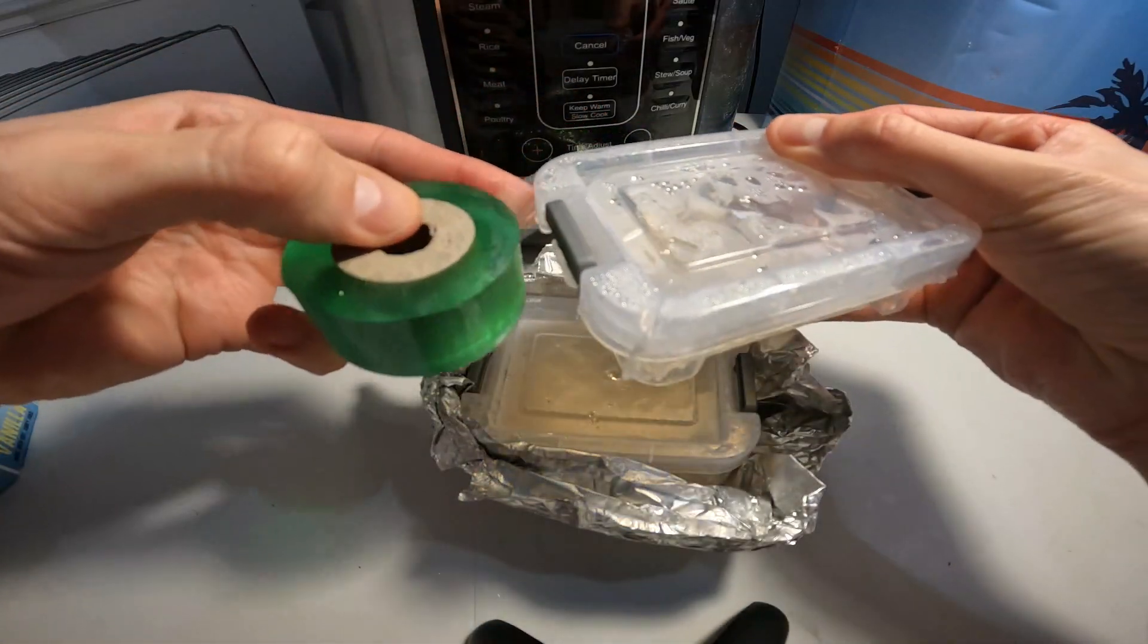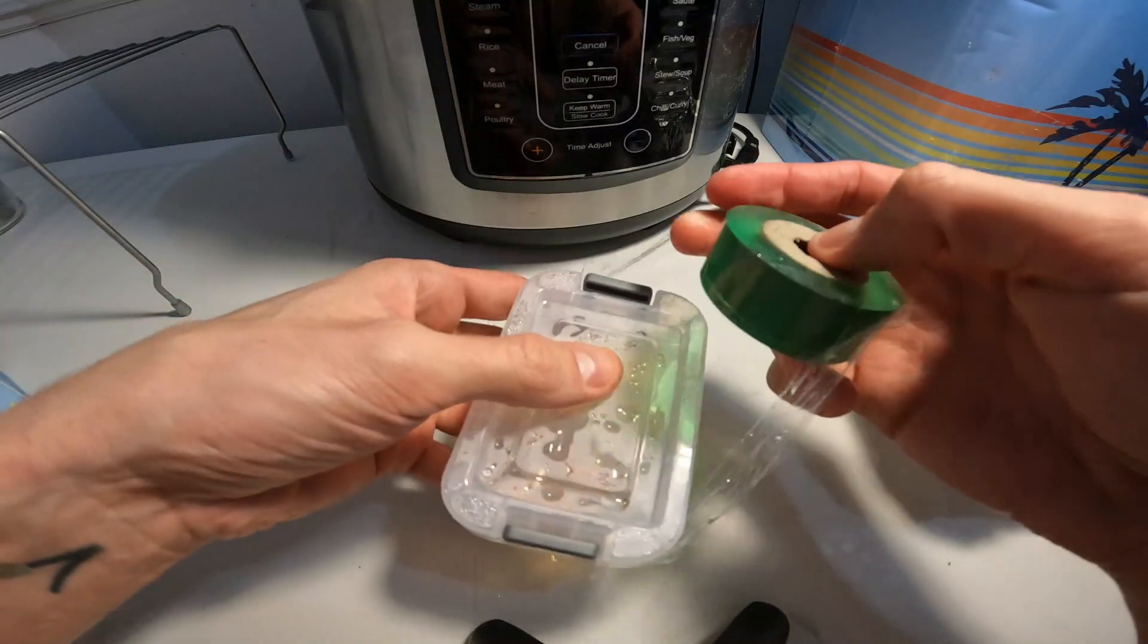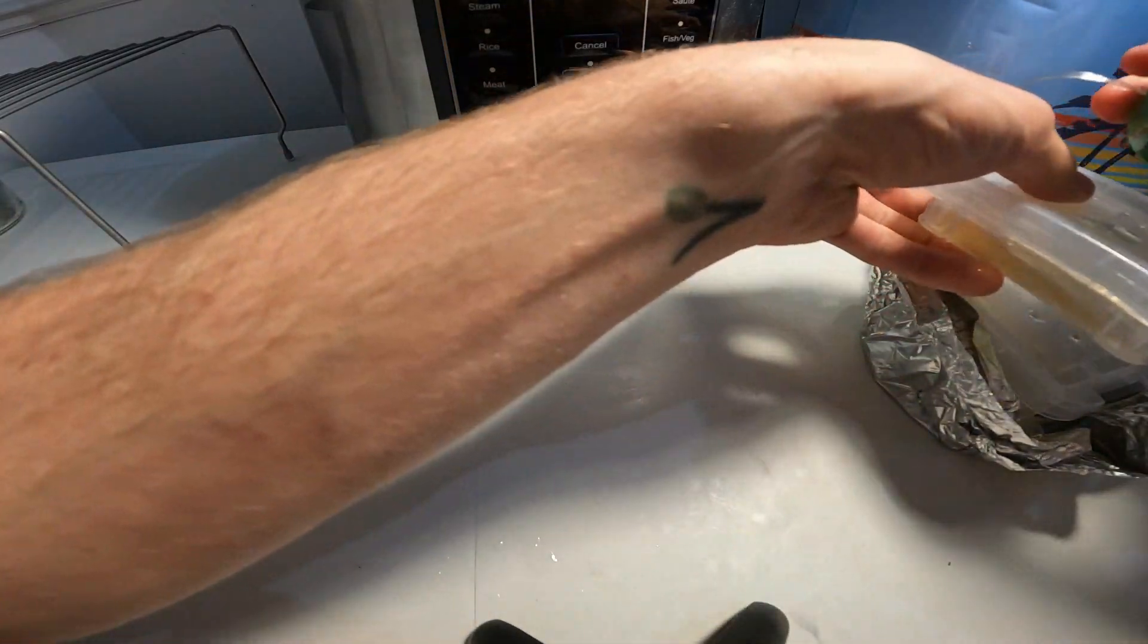Though of course, the best thing about this method is the fact that the pots are so hot I can barely hold on to them. And it turns out to be an absolute shit show when I'm trying to wrap them.